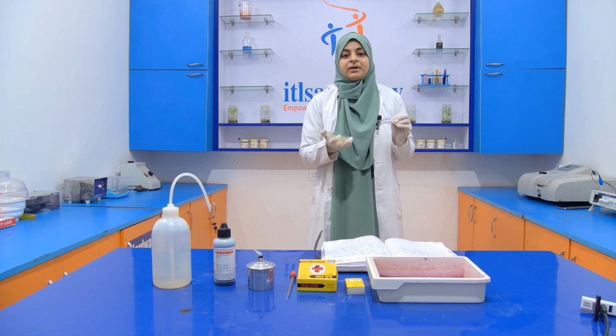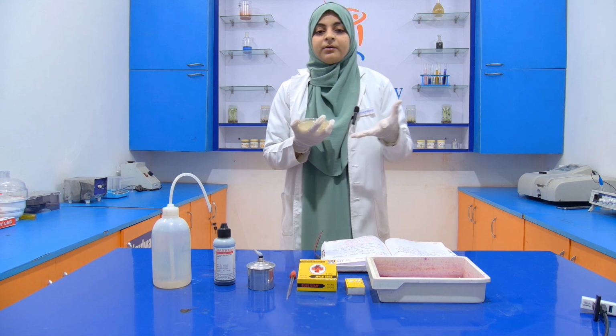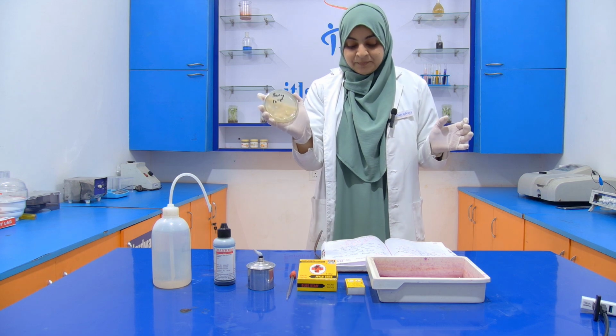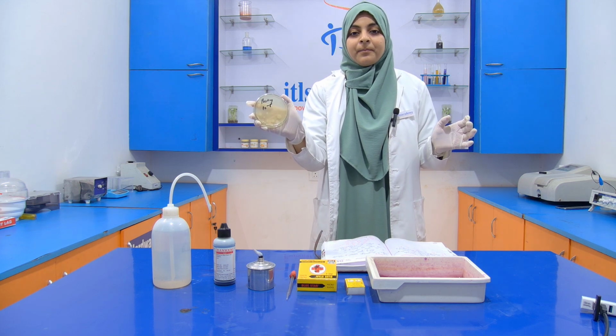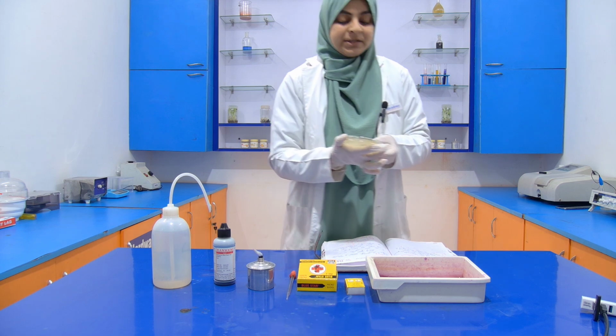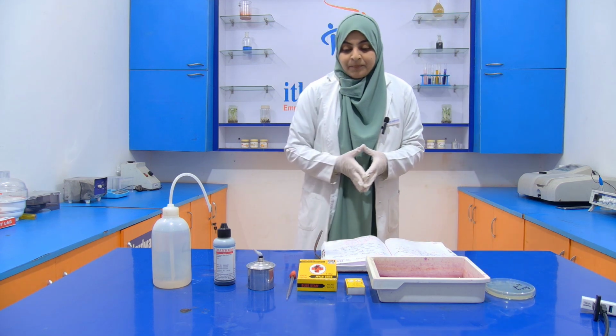You can visit and see them, then you can understand better. Now we already have a culture by the pour plate method, with a 10 to the power minus 4 serial dilution.